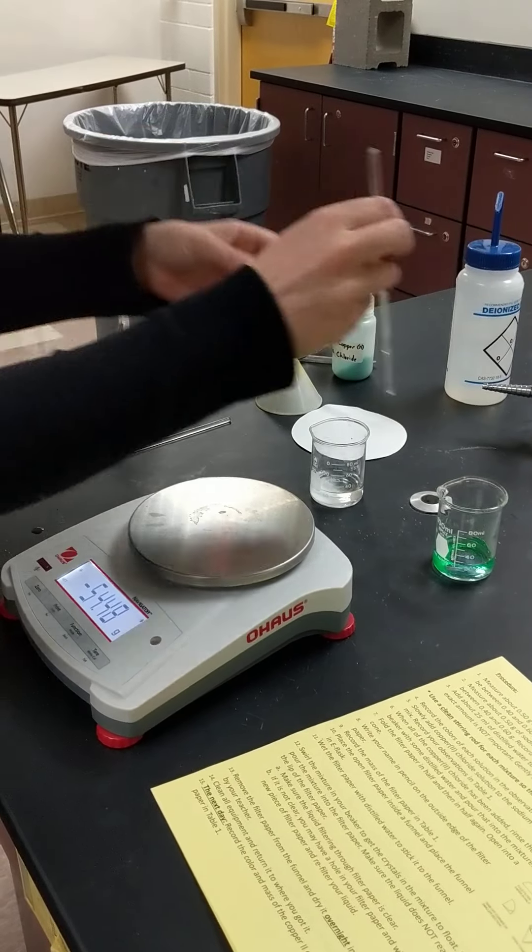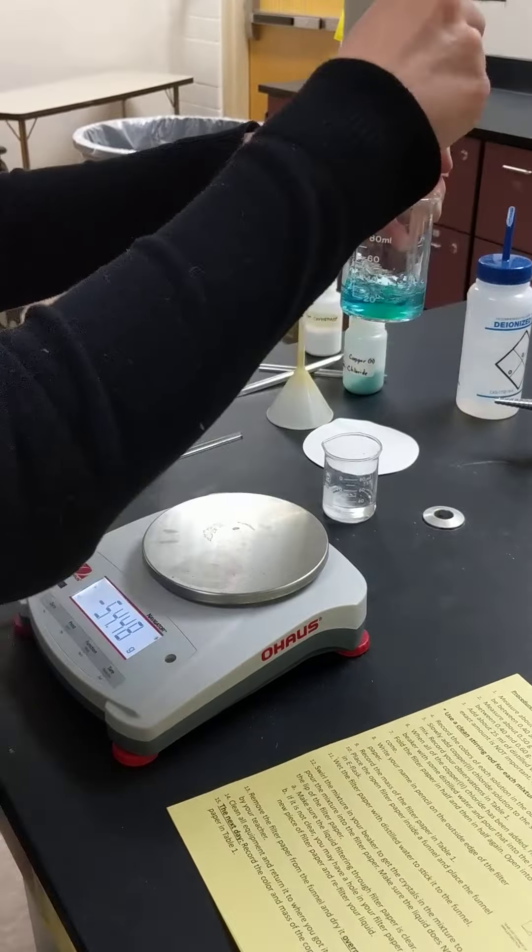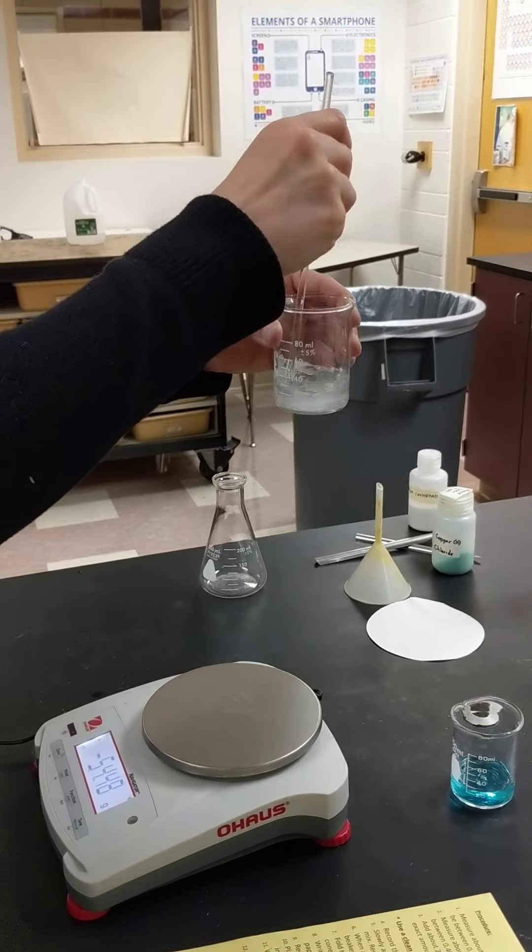And then we're going to take stirring rods and we're going to stir until it's all dissolved, so we have no more granules. So that looks all dissolved there. And we're going to do the same to the sodium carbonate.